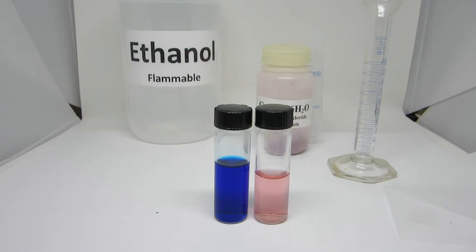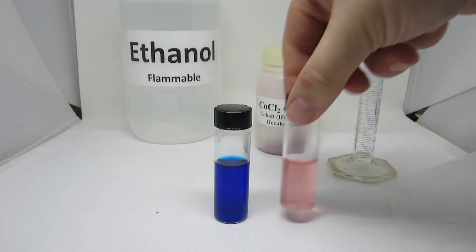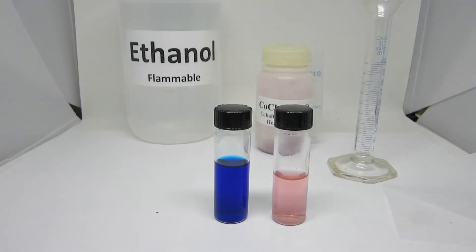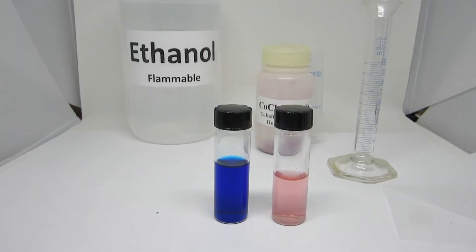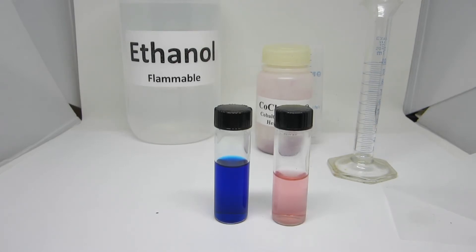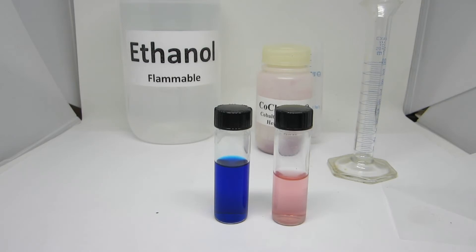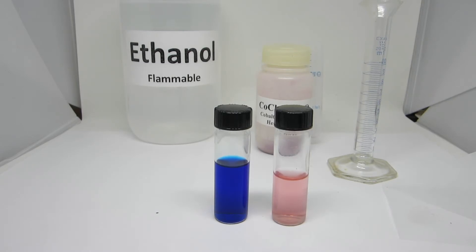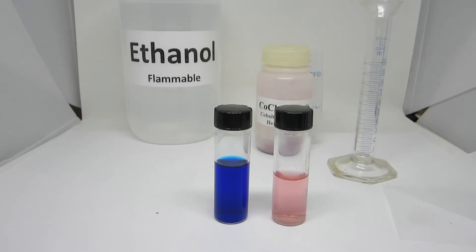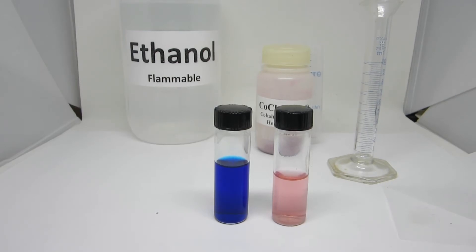When more water is added, the equilibrium will shift to the red cobalt-hexa-aqua complex. By knowing exactly the concentrations of all four components of the reaction — the cobalt-tetrachloride, the cobalt-hexa-aqua, water, and free chloride ions — you can calculate the equilibrium constant of this reaction and determine at what points there are more products or more reactant.